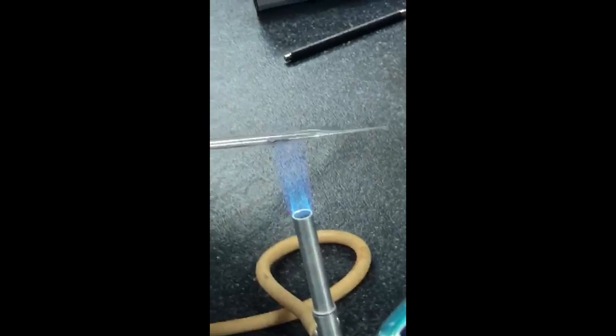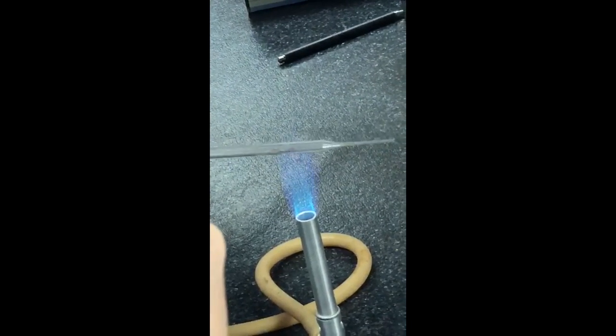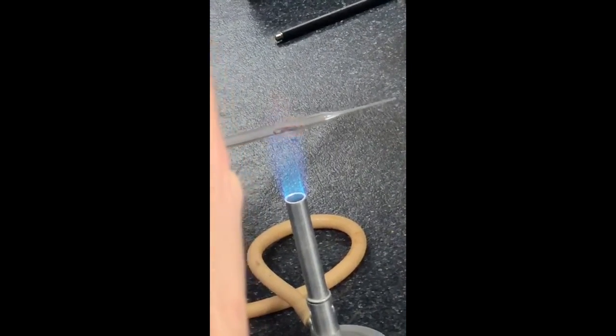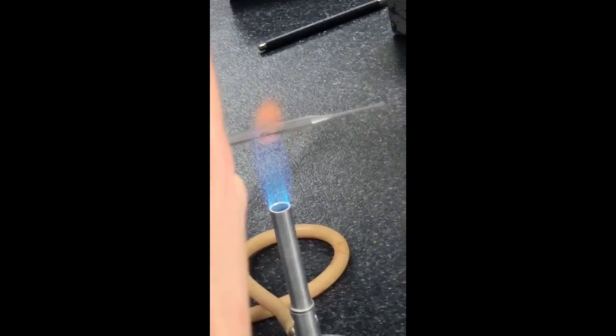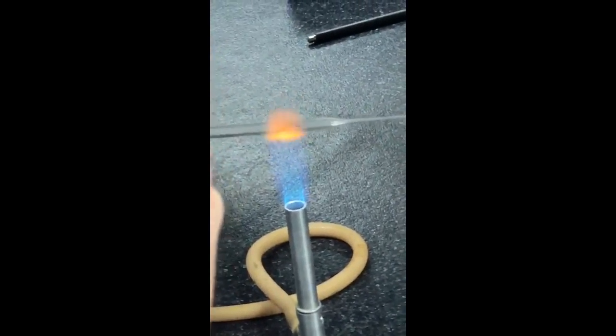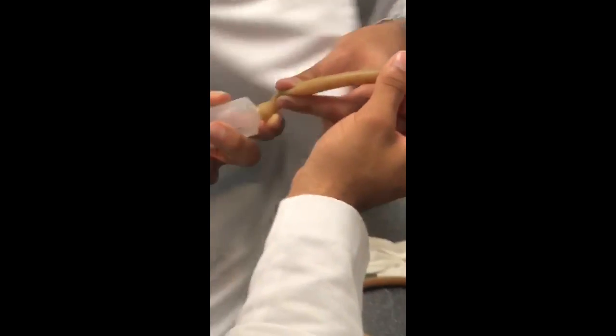Okay, to prepare the hydrogen, we needed 0.10 grams of solid magnesium and 5 milliliters of hydrochloric acid. To do the experiment, we put water in a plastic container, then filled a test tube completely with water, and covered it so that the water doesn't come out. We put a syringe and put the hydrogen into the test tube. Then we lit a match and put it in the mouth of the tube. What we heard was a small explosion due to the hydrogen.